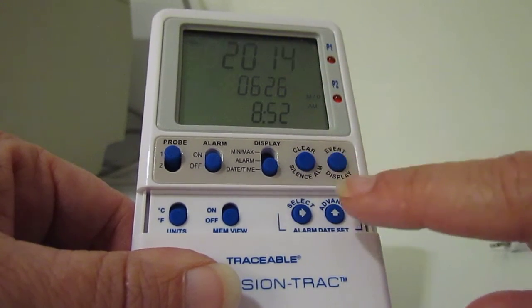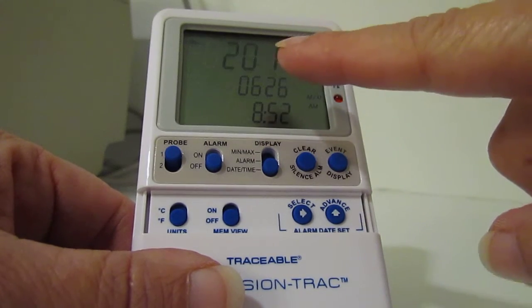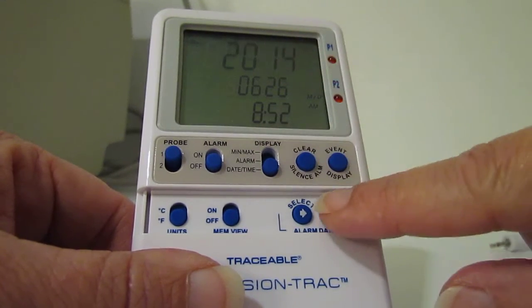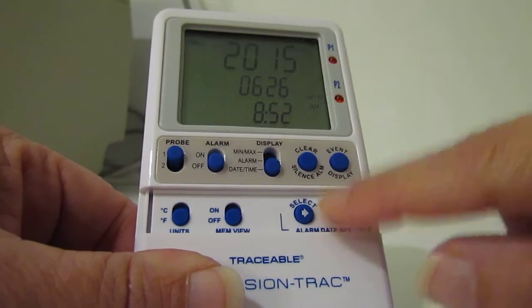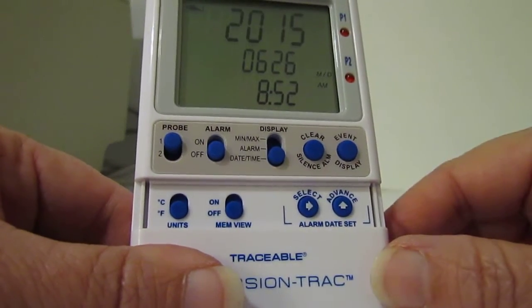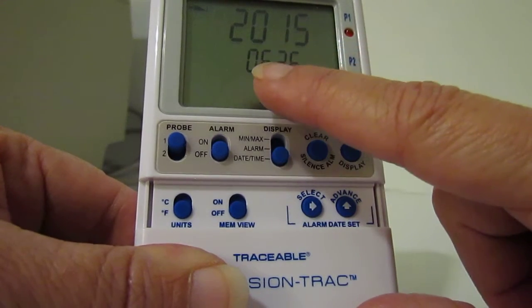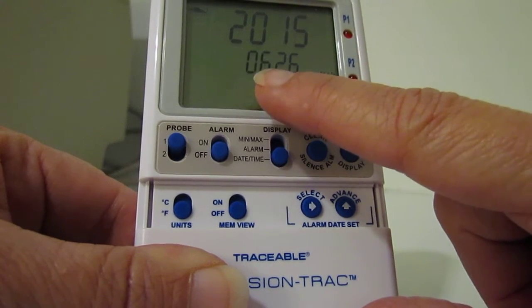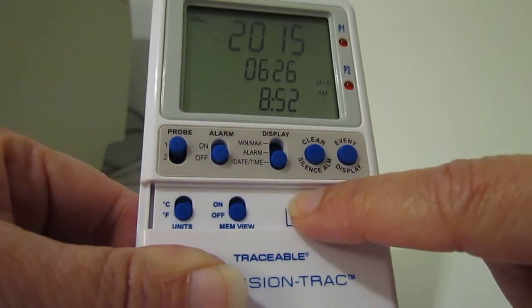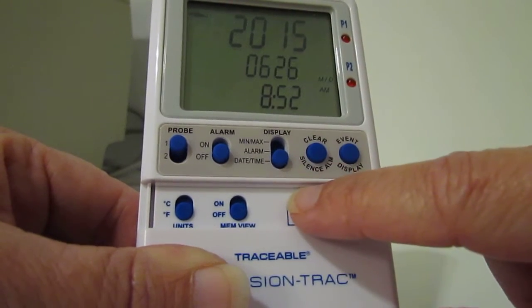The first number is the year — yours probably says 2000, so press the advance key until you get to 2015, then hit the select key to go to the next field. You want to do the month, then select to get to the day.